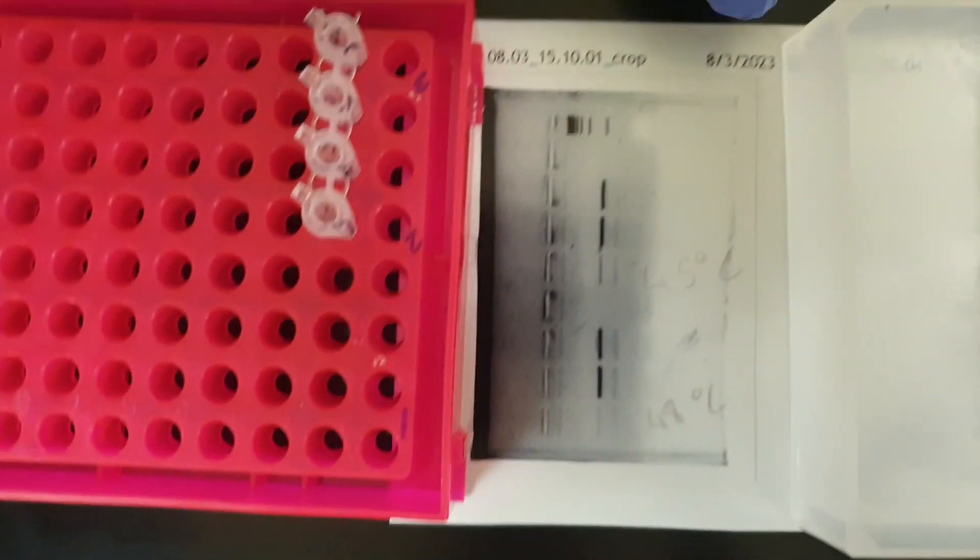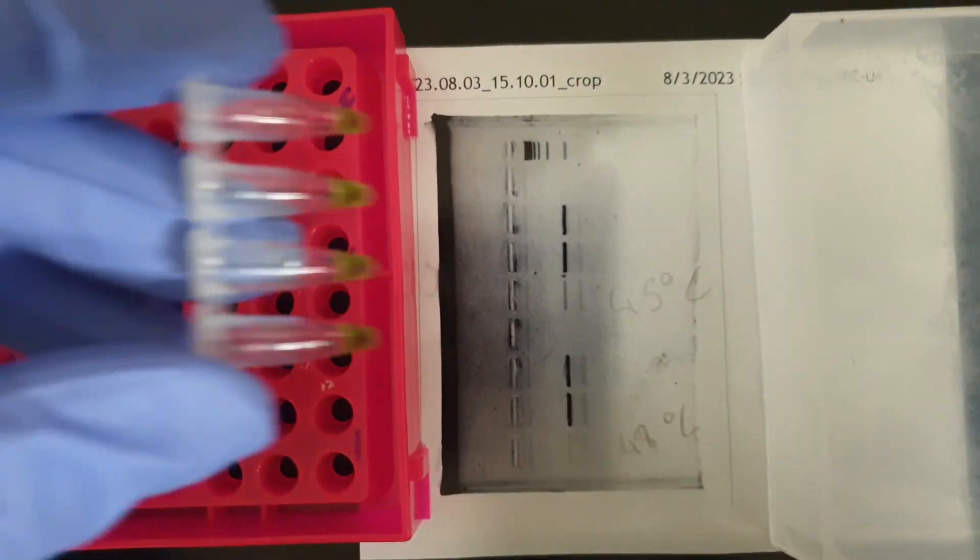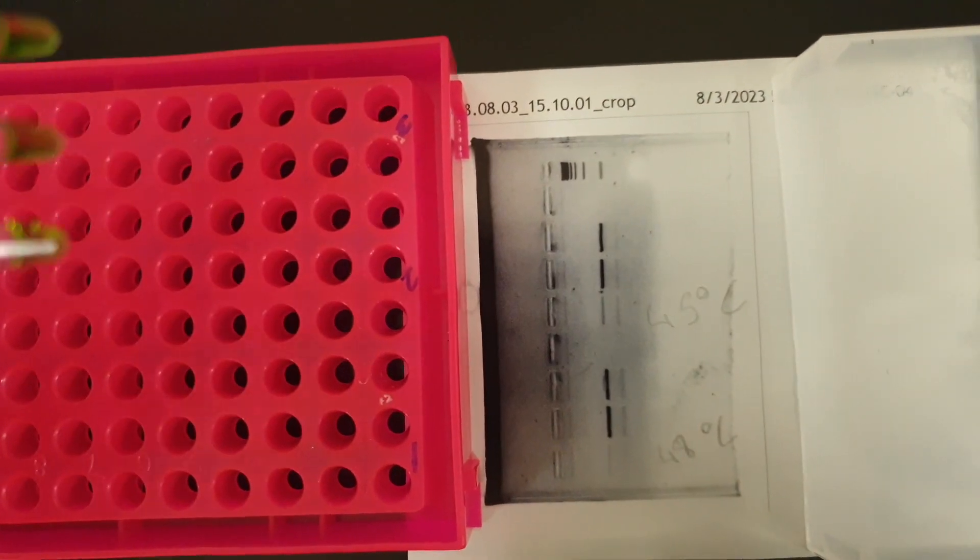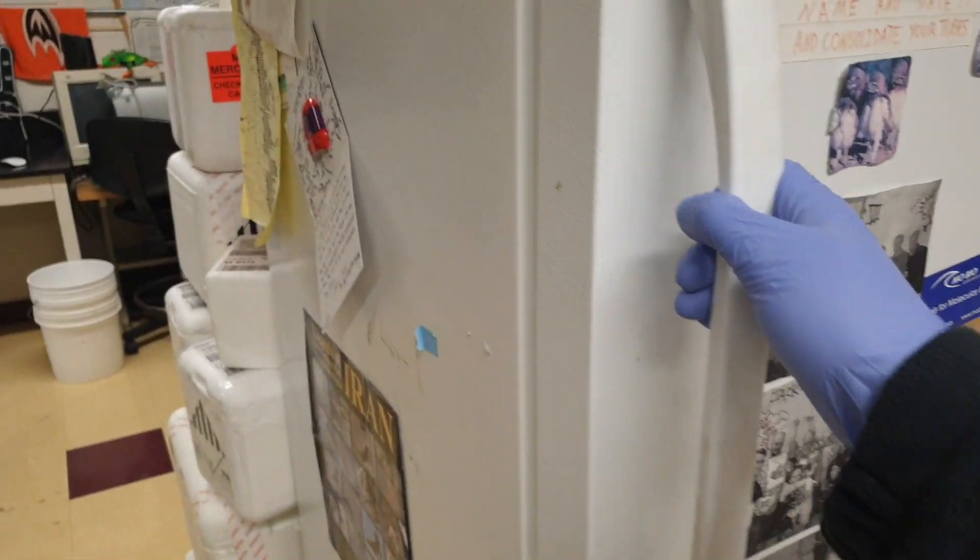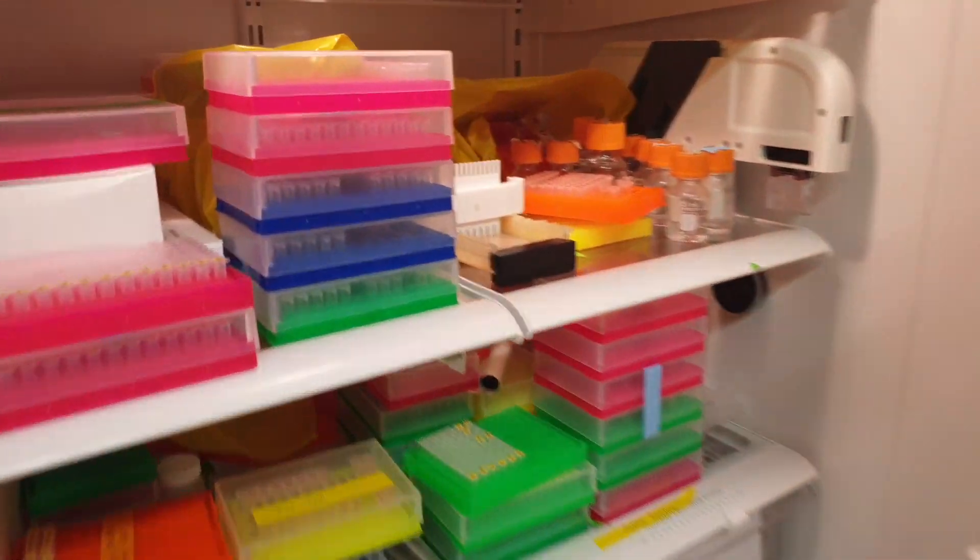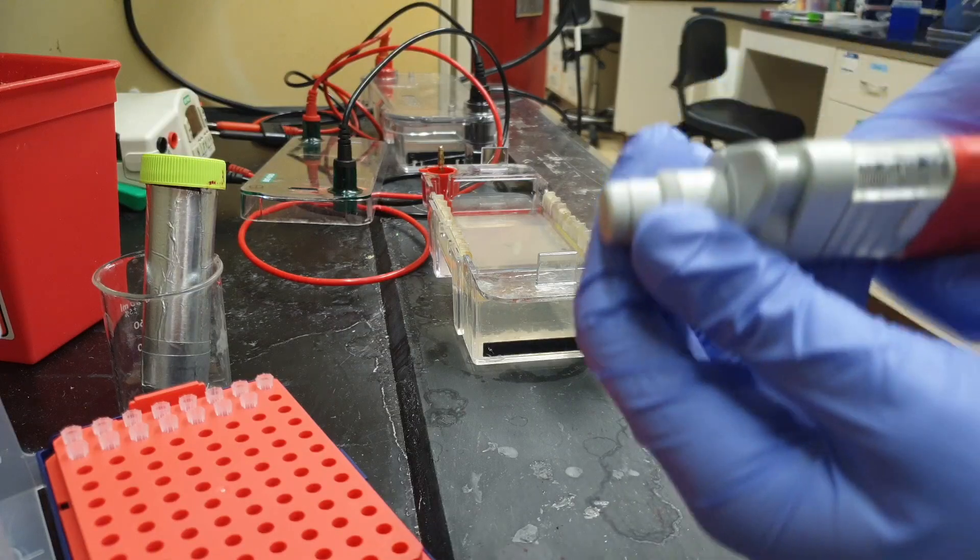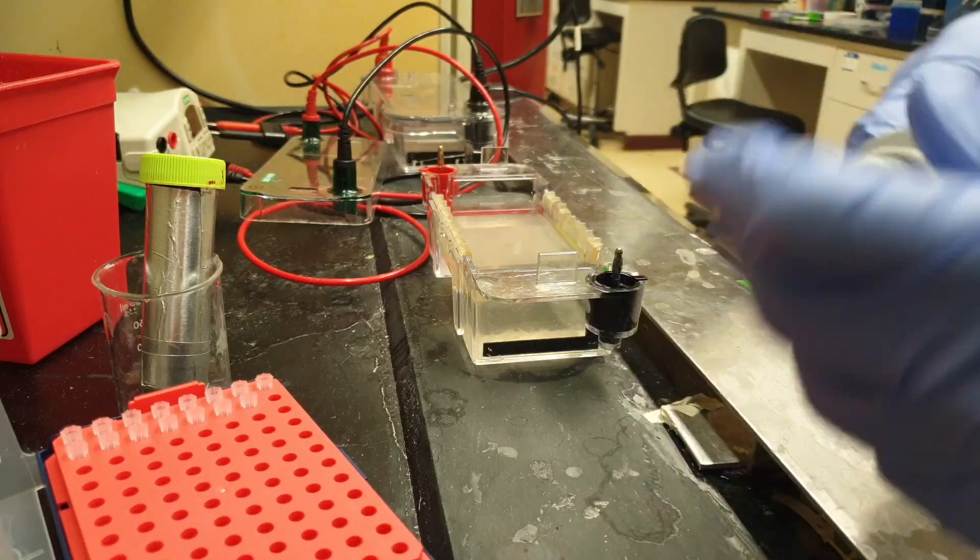These results you see over here are coming from gel electrophoresis of these post-PCR products. We will use the same products and run them on low melting temperature agarose now. Alright, it's been 10 minutes. Let's open the fridge. It looks like it's solid now. Now instead of putting 5, I'll put 10 microliters of each PCR product.